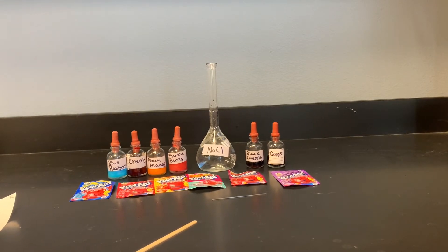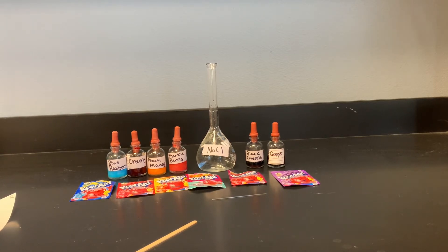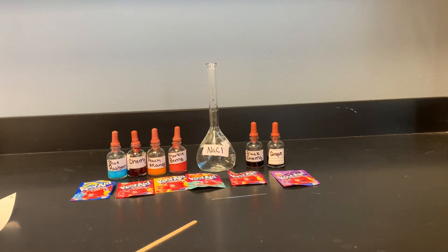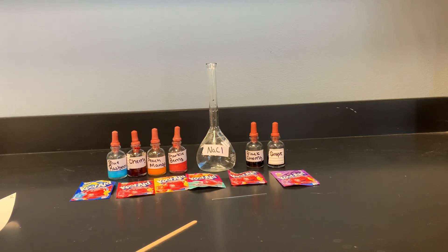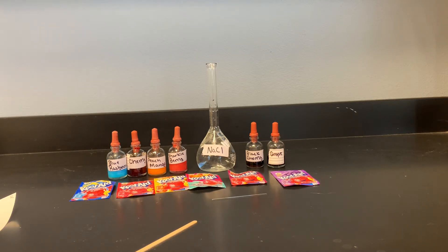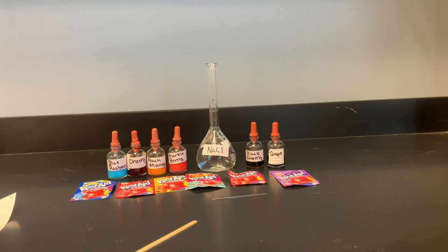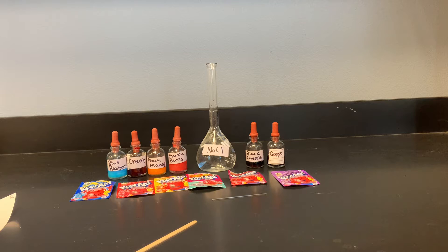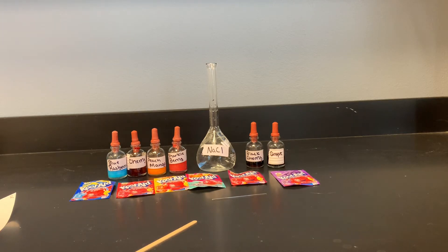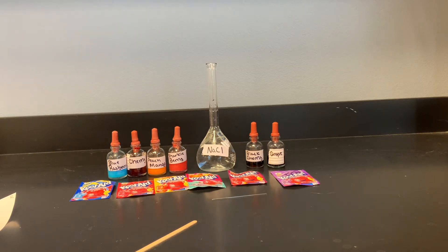Going back to your grape Kool-Aid — it is purple because it contains Red 40 and Blue 1. In this lab, I have concentrated the Kool-Aid so that when we place it onto the chromatography paper and use a solution of sodium chloride, we're going to separate it into its components. The reason you have additional Kool-Aid here is because I want you to read the back of these Kool-Aid containers and see what colors they contain.